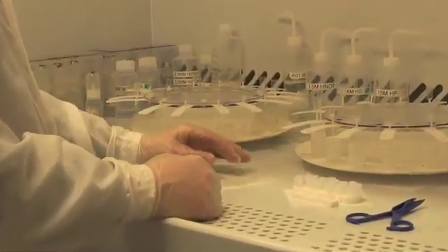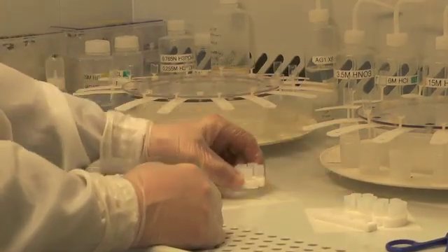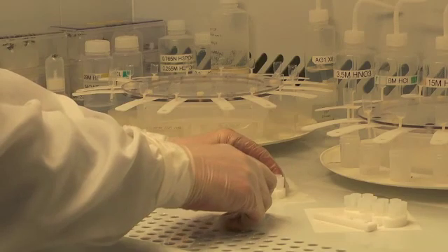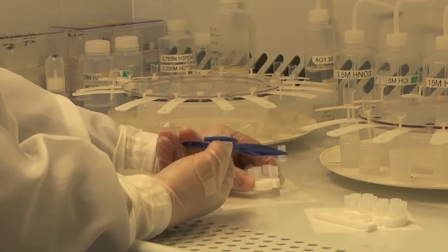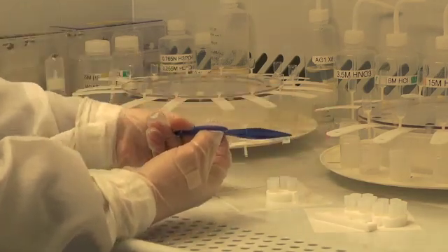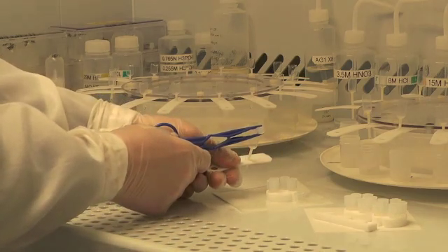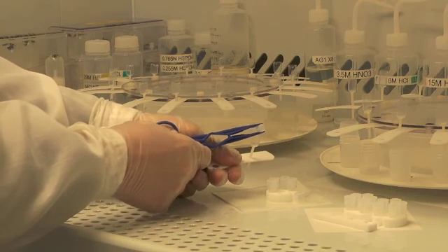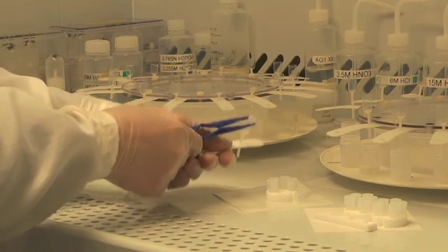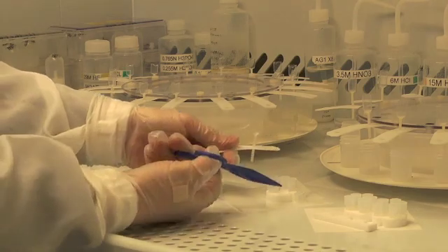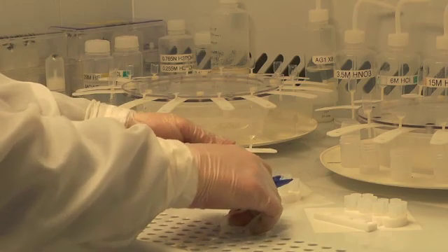Now that my columns have equilibrated, I'm ready to load my sample from the microcapsule into the column. First step is to take the lid off and ease the capsule out of its puck. I'm going to grasp the column between my thumb and forefinger and invert the capsule over the reservoir. Holding it at an angle, a short tap or set of taps on the surface of the bench releases the acid containing the sample into the reservoir.